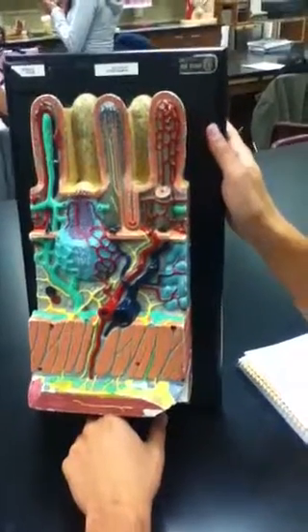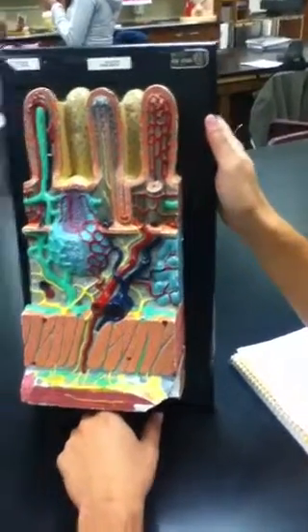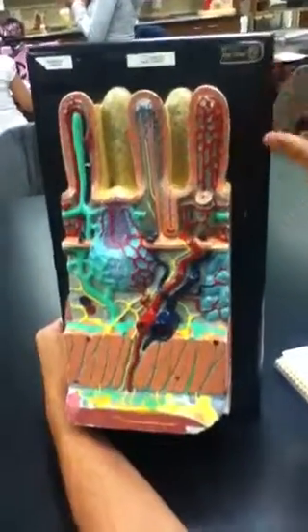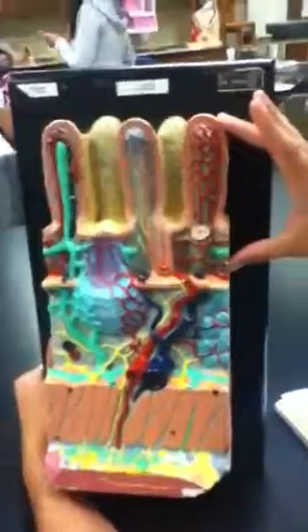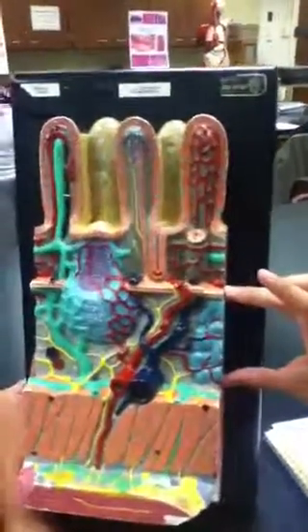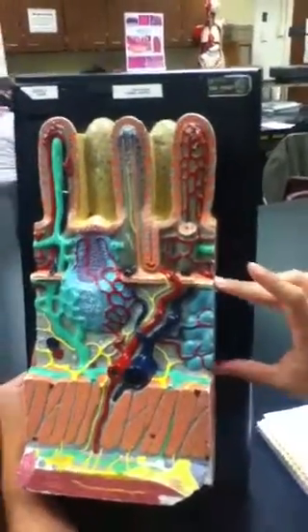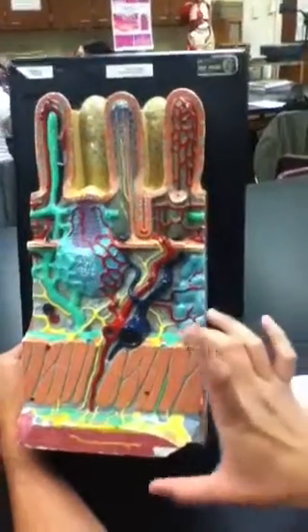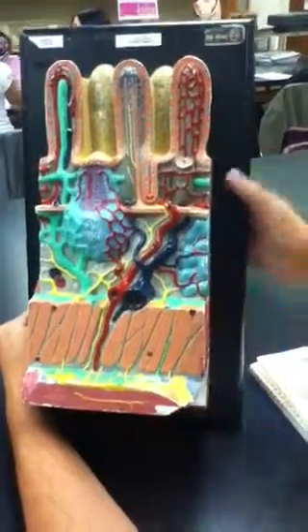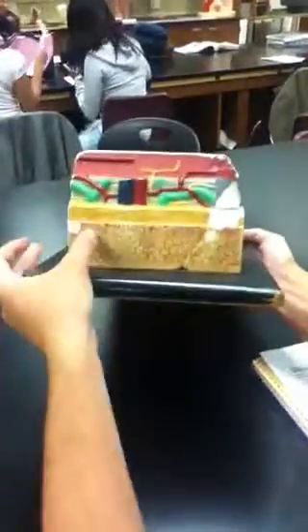This layer is your mucosa, and you have your submucosa, then your muscularis externa, then your serosa.